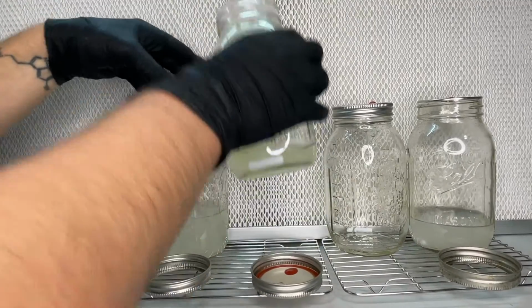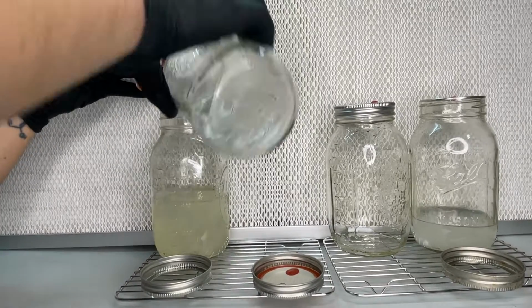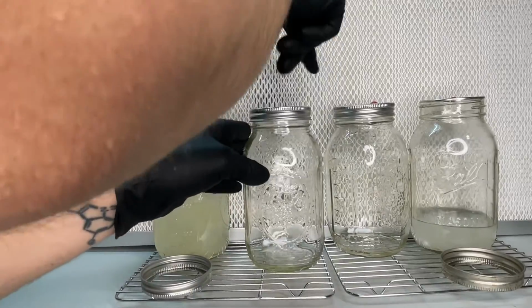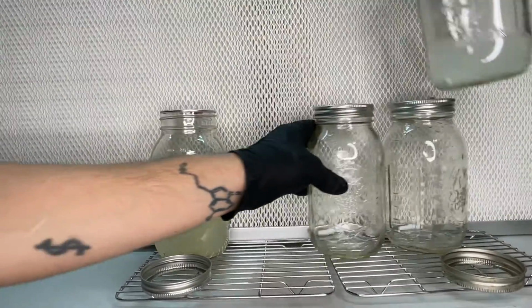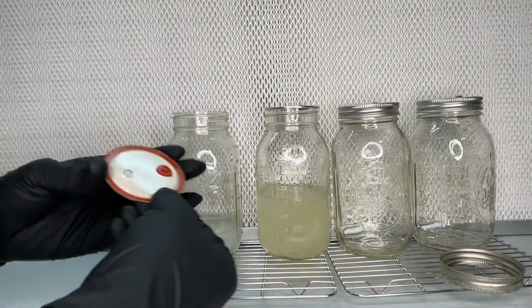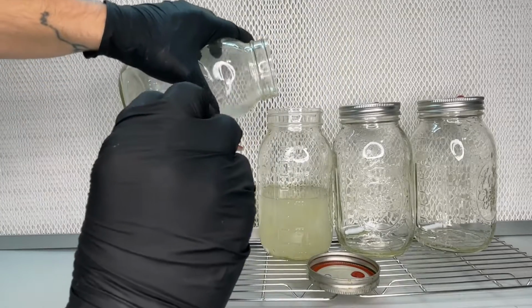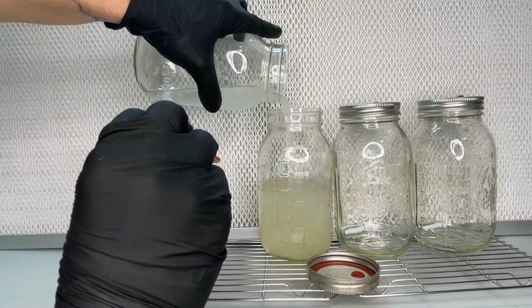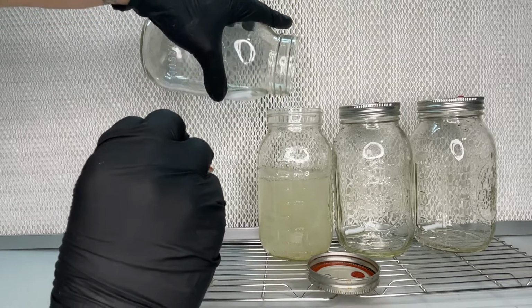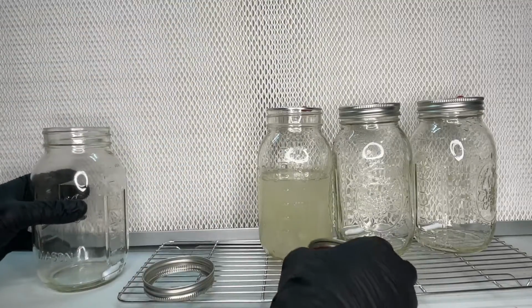By taking the small amount of mycelium from four jars and dumping it into one jar, I now have a full jar of mycelium that can easily be made into syringes. I've done this a lot of times and I've never had any problems. But as always, you can test the final liquid culture jar on agar plates to make sure it's clean.